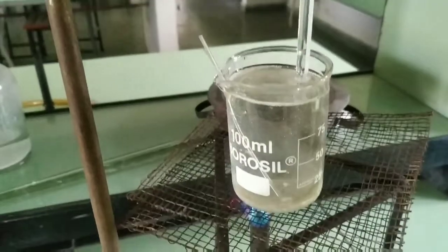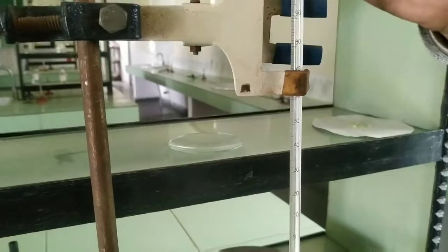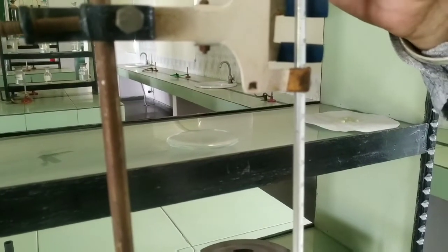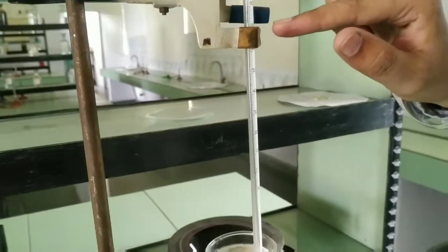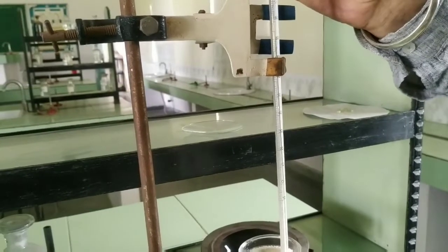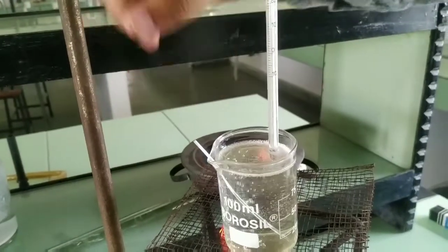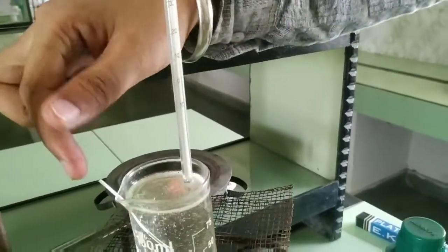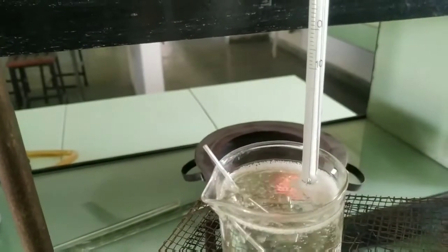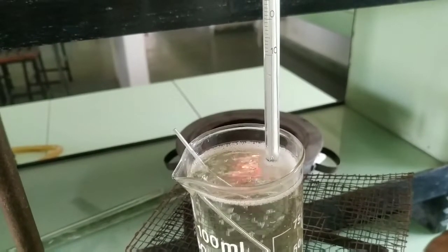We are continuously heating and we have to check the temperature of the thermometer. Students, you can check here the temperature of the thermometer is continuously rising — the temperature is lower than 70. As the solution continues to be heated the temperature will rise. We have to continuously check this capillary tube for when the salt will melt, and we have to take the temperature at that point.